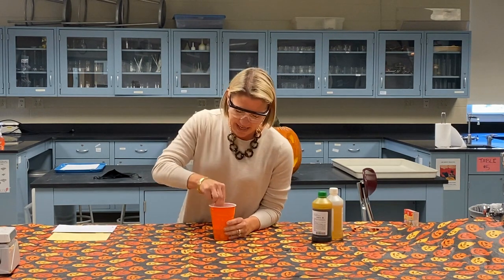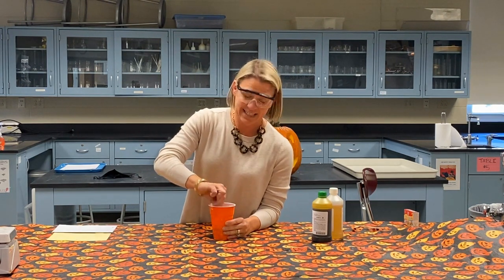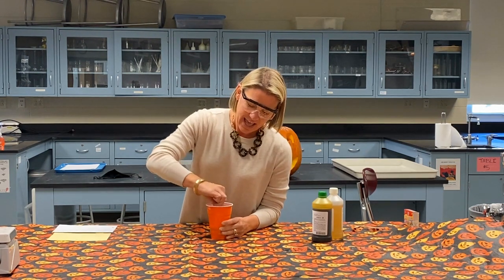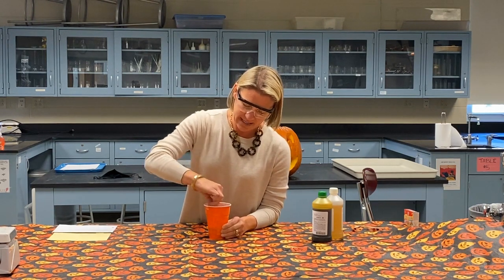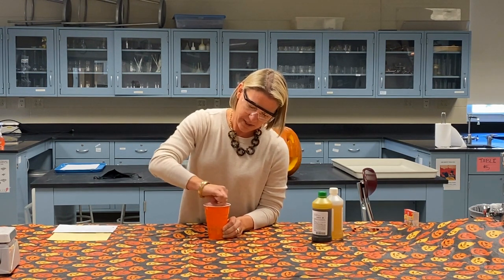And so what's happening as I'm mixing this, I'm causing this to react. And the important thing is, as this is reacting, we are going to trap a gas, carbon dioxide specifically. And then once that happens, it'll increase in volume. And that's why I'm stirring here to get this reaction to go and the polymerization to happen.